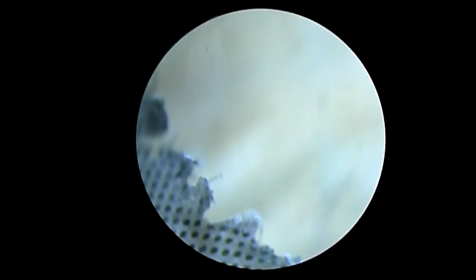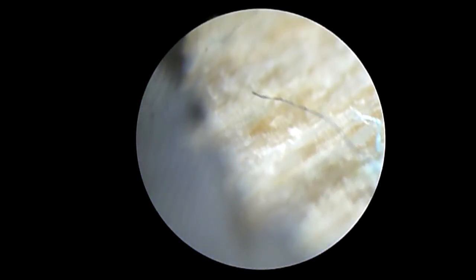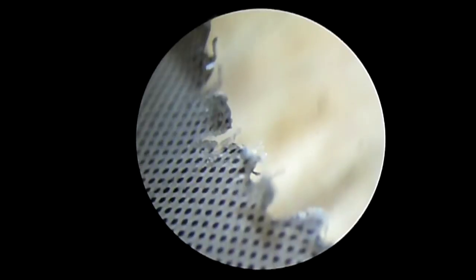I'll bring it up to ten times objective now, which makes it a hundred magnification. So there we go through there. And focus a bit, just a bit. So there's the wood and that hair again, looking bigger and bigger. And there's all of the rips.